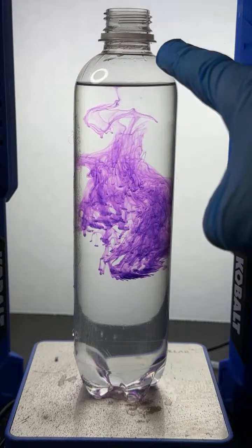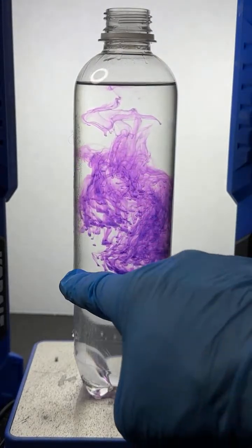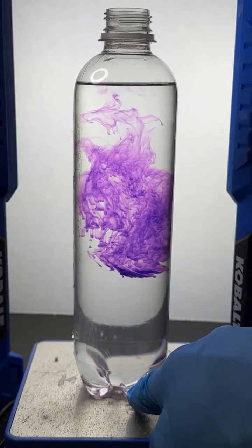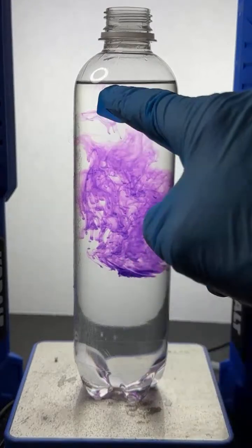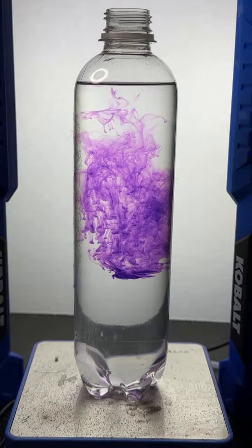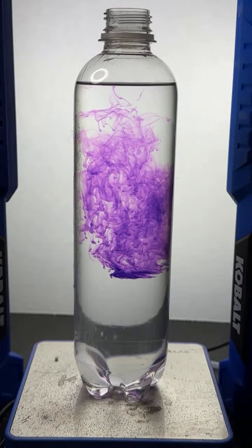You can actually see it now. So you can see kind of the alcohol layer here. The dye is not going any deeper because this is sort of the amount of alcohol that I added. And then you can see the water layer here. The dye just kind of stops there at the interface between the two. All right? But if I mix it up, if I cap it off.